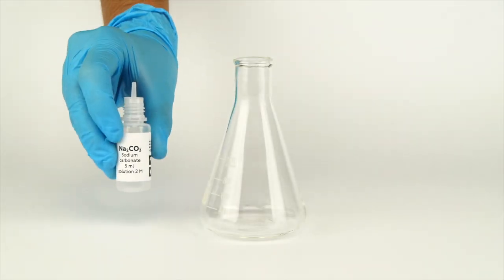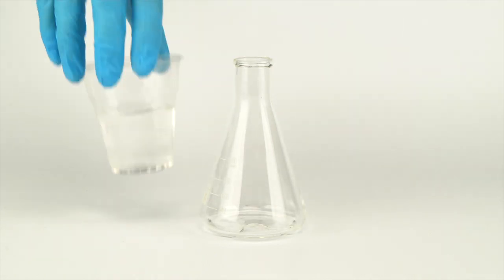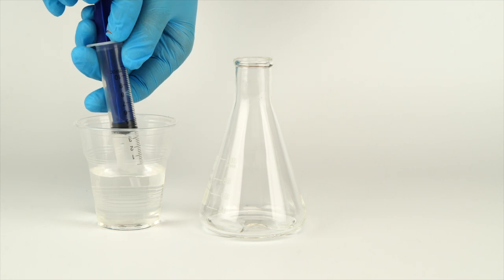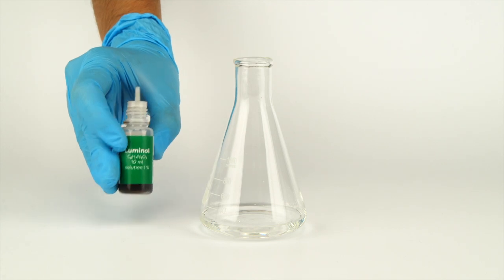First, prepare an alkaline luminol solution. Pour one bottle of sodium carbonate solution into your flask. Use your syringe to add 10 milliliters of water. Add 15 drops of luminol solution.